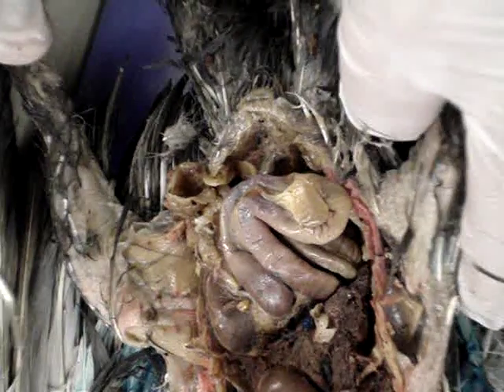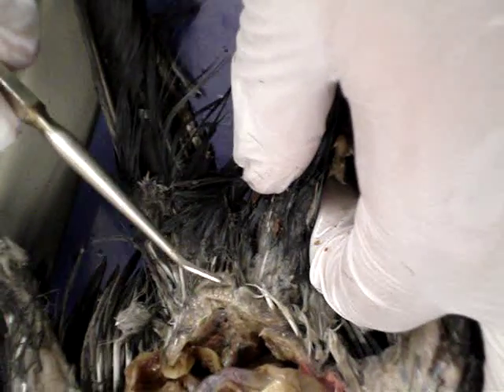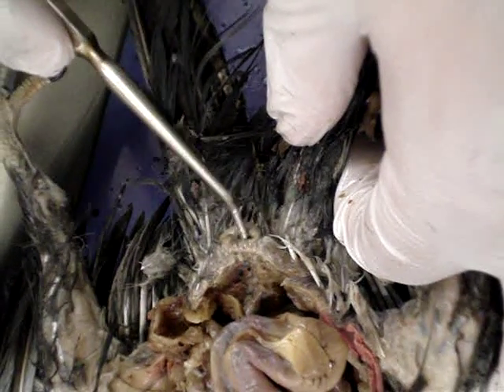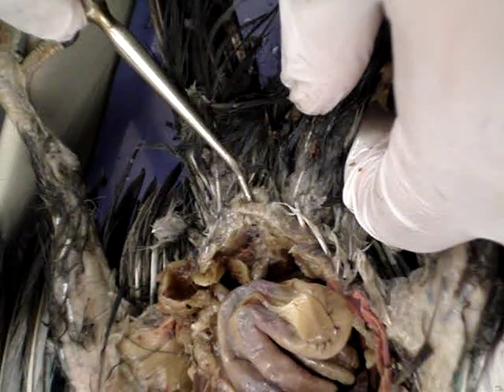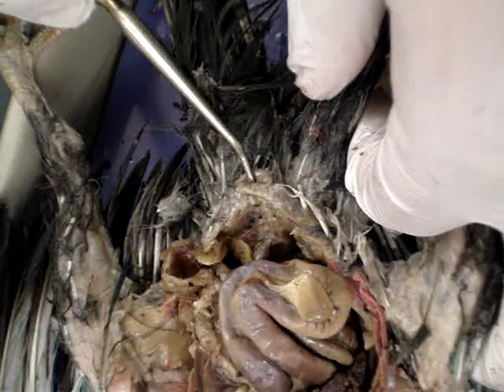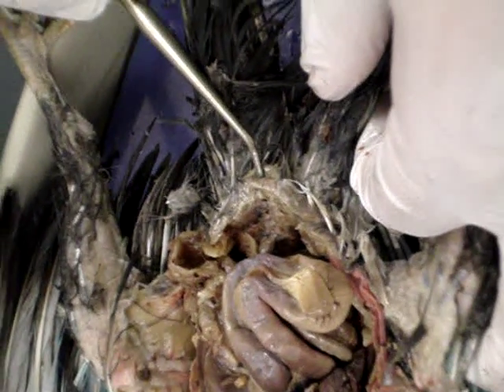Cloaca. It's the bottom of the bird — the opening that is here, leading to the inside. It's the cloaca, and simultaneously the anus and the sex organ. When birds make babies, they rub their cloacas together.